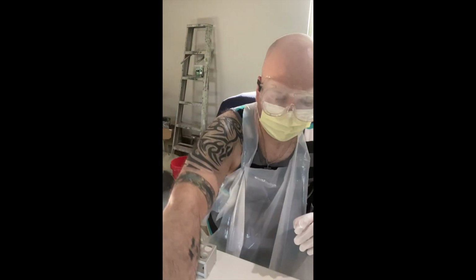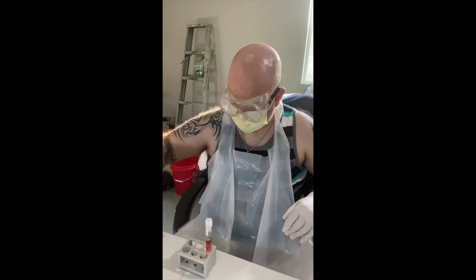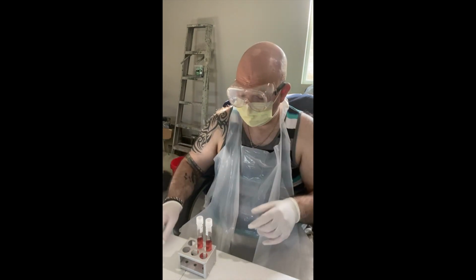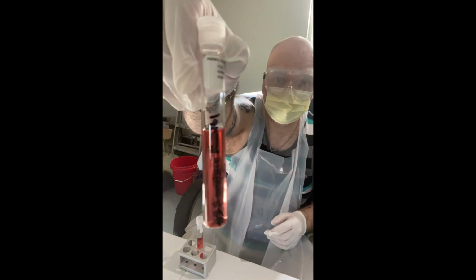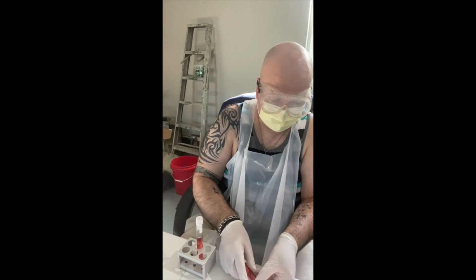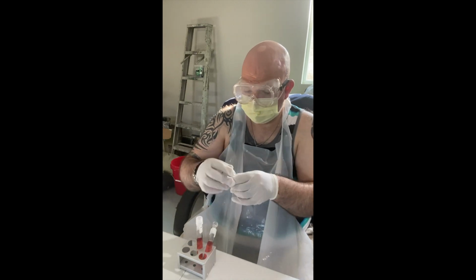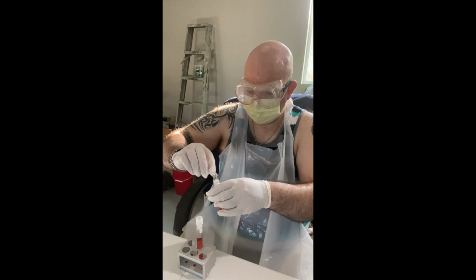Okay. And then lastly is the mannitol. So my last two tubes. Here's the mannitol, which again is powder very similar to what the glucose looks like. This is the cerevisiae one. Running it through the flame to sterilize. Okay, back to the test tube rack. Lid off the mannitol. And then again, half goes in here.